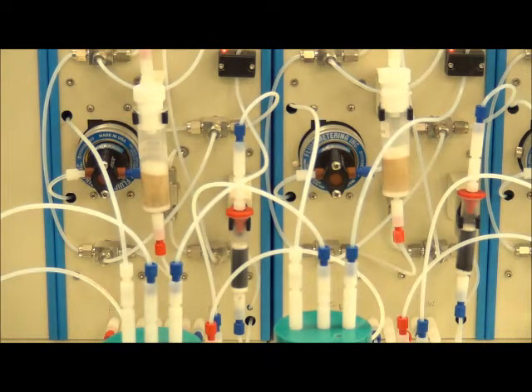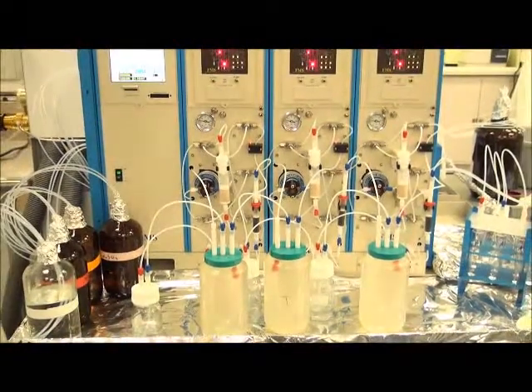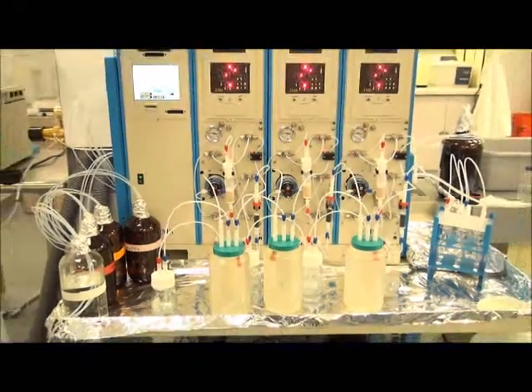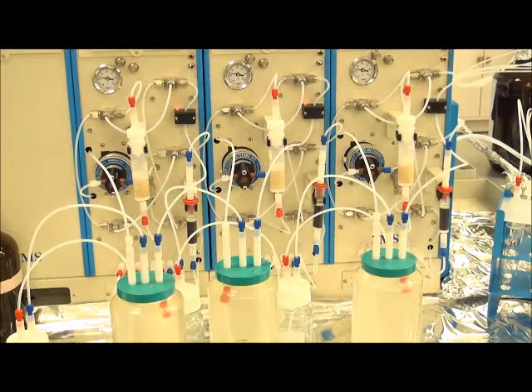The other cartridge. Following which, the pump will now begin to exchange to methanol and continue with the remaining conditioning steps before sample loading. At this time, we're finishing up the cartridge conditioning, and we will be about to begin the sample loading with the vacuum pump.